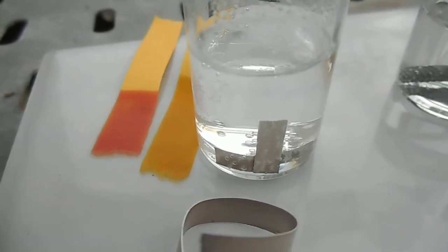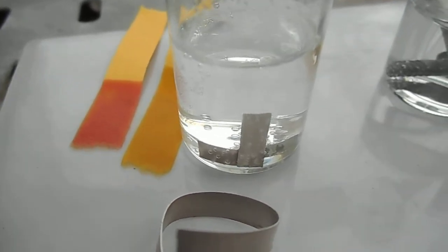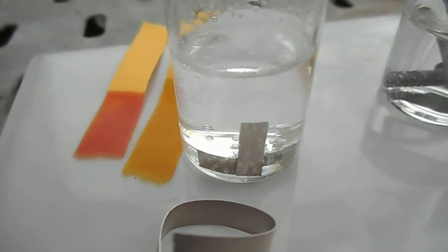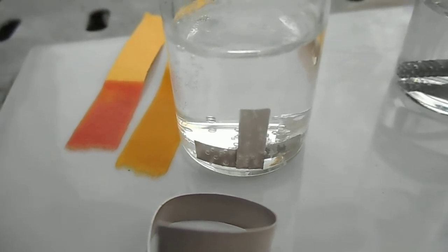So the magnesium has reacted with most of the acid in the first one. Hence the now extremely slow rate.